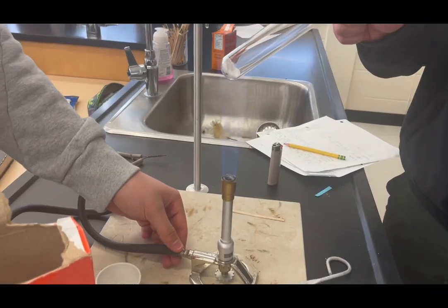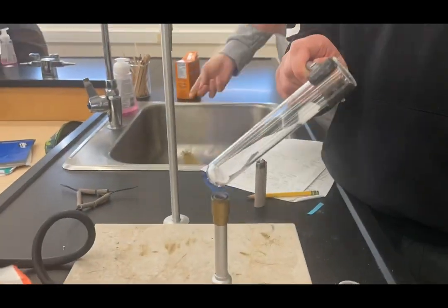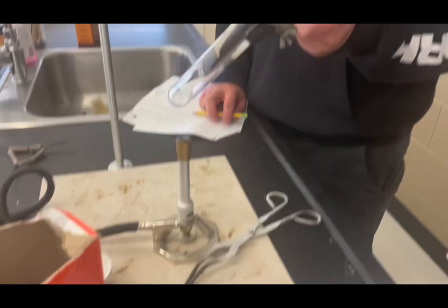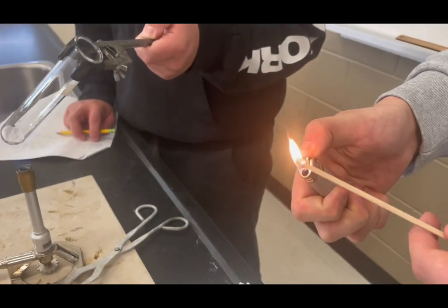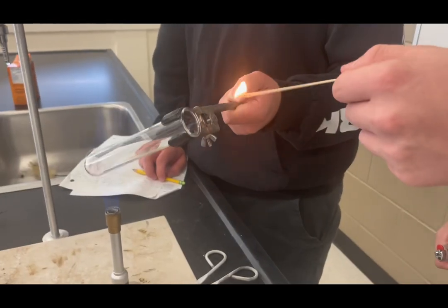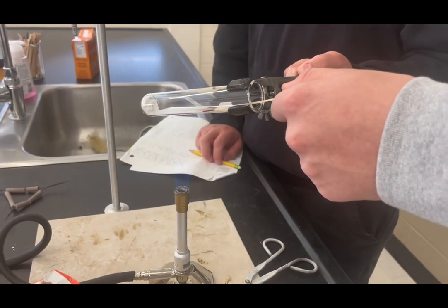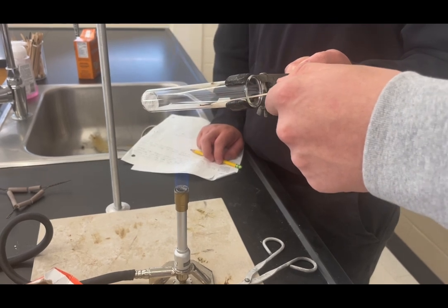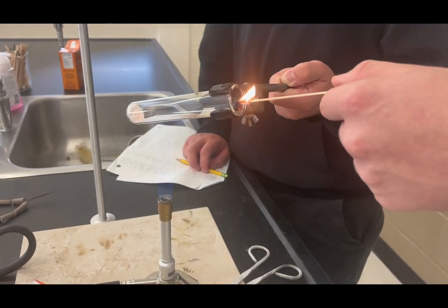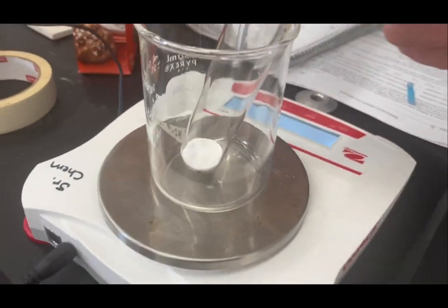This is the source of error, I think. So right before we went to measure our mass, I actually dropped the crucible lid on the ground and it shattered. So this is us repeating the process but using a test tube instead, because we thought it would be better for our splint test, which proved that there was carbon dioxide in it since it went out. We also did a water strip test, because moisture actually can't be made in the crucible but it could in the test tube.